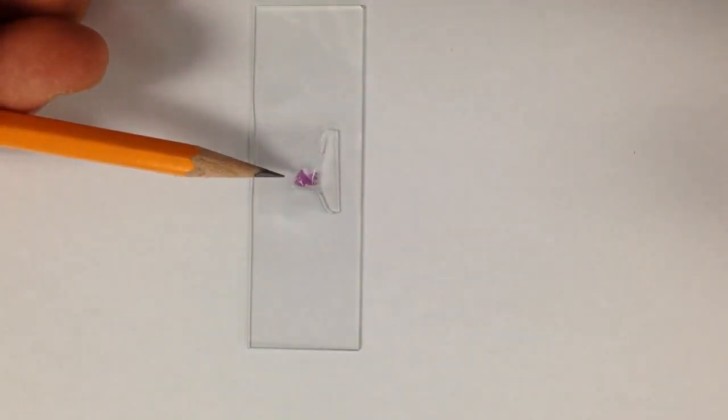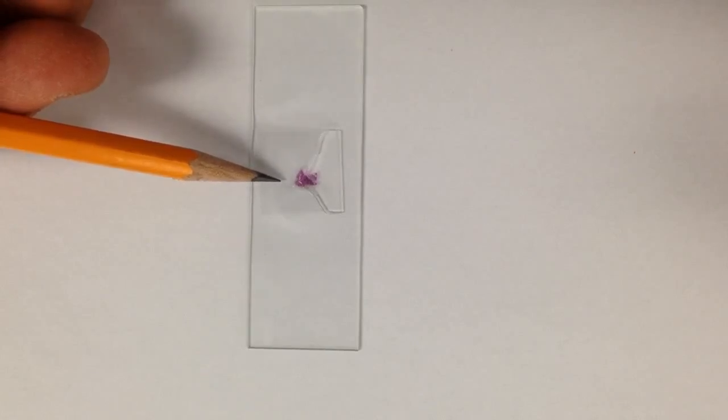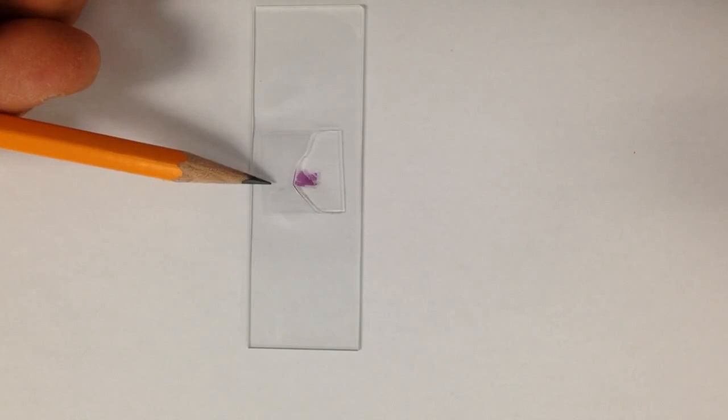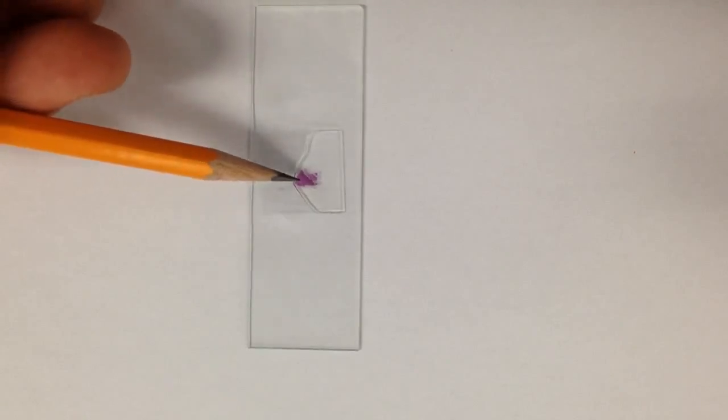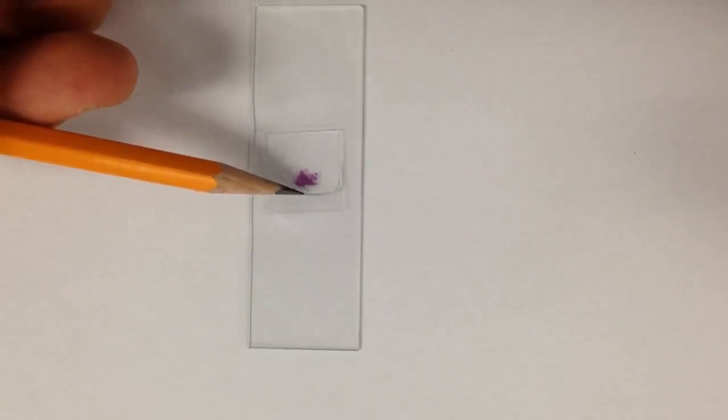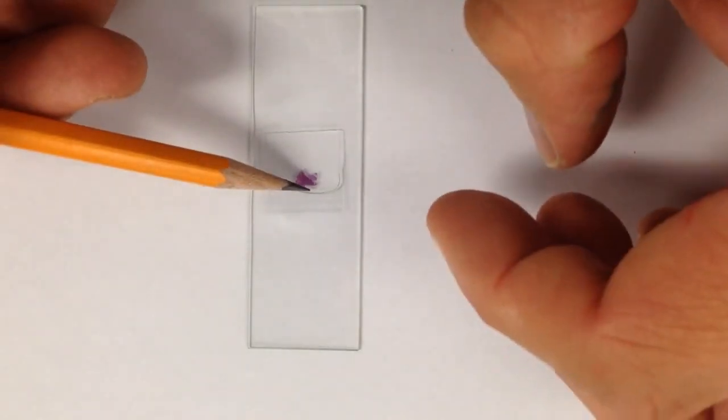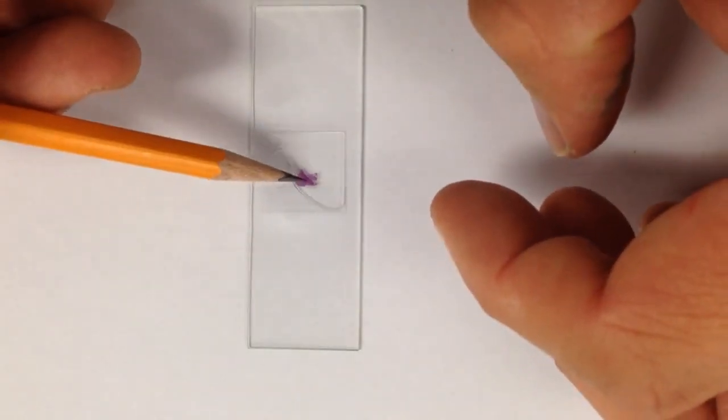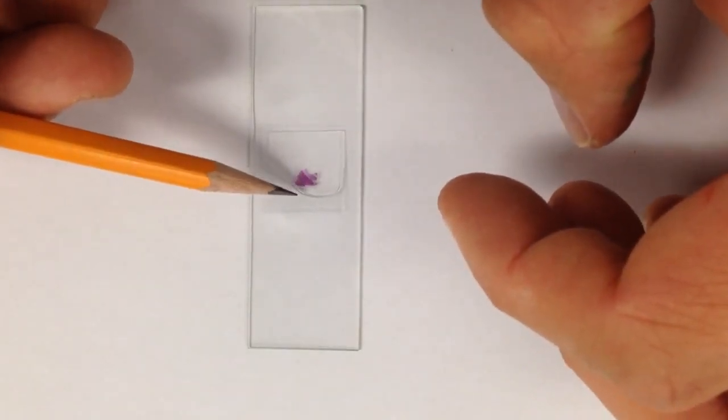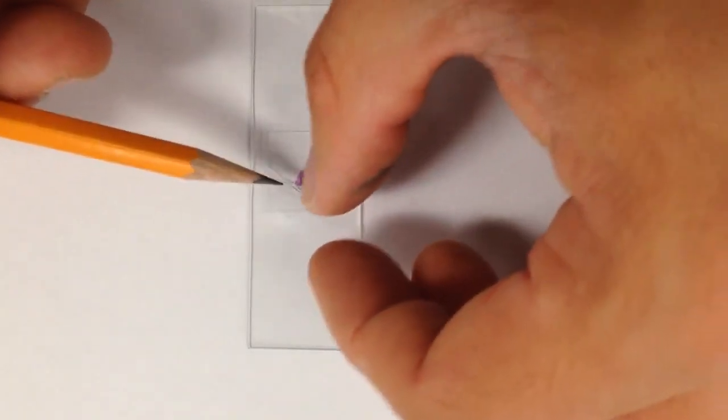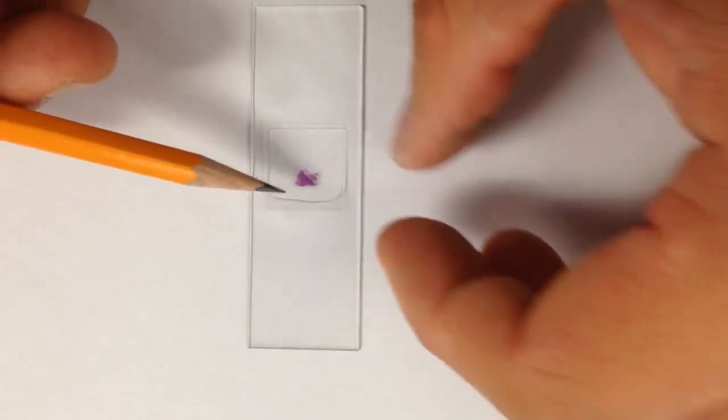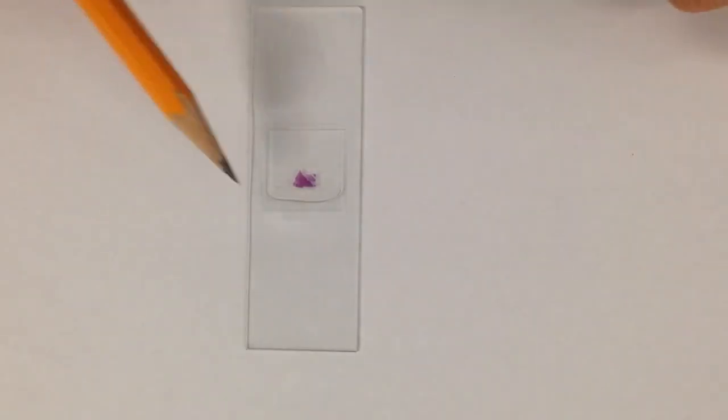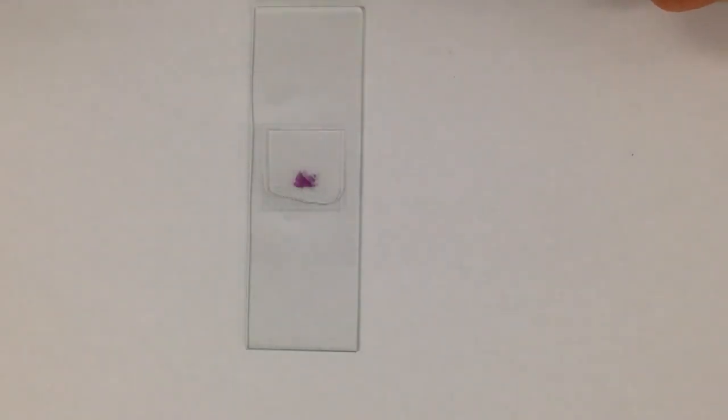Once you do that, you want to slowly lower it down to the glass slide, and once your pencil hits the glass slide, start pulling it back so the water starts moving across the bottom of the glass slide. And depending on how large your specimen is, it should fall. This specimen obviously is a little thick, or maybe the skin is folded over, so it's not going all the way. But as you can see, the water is now engulfed around there, so that's how you make a wet mount slide.